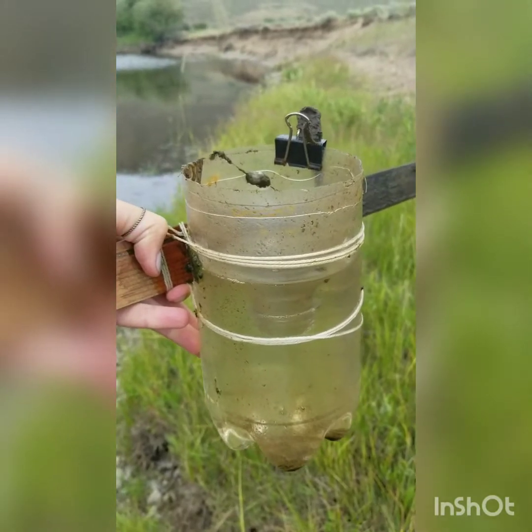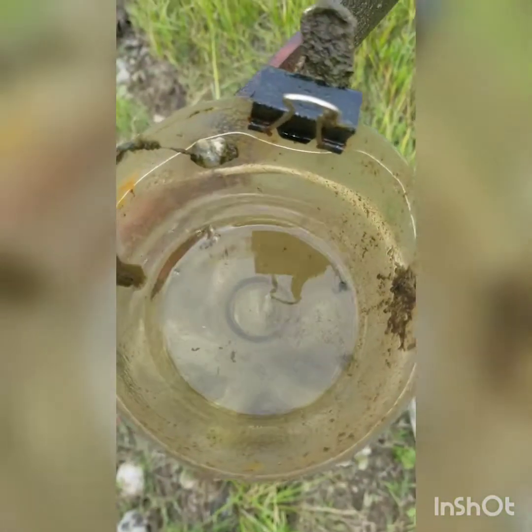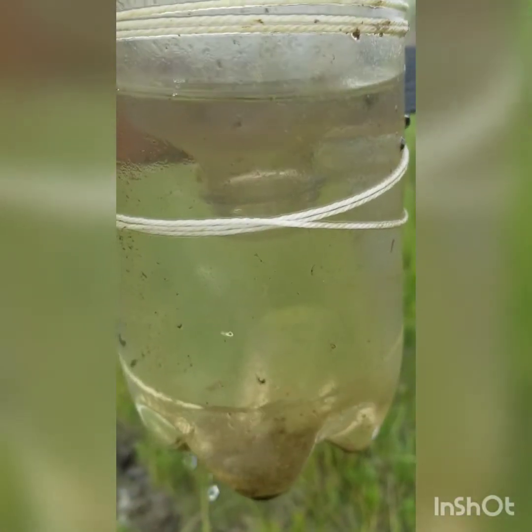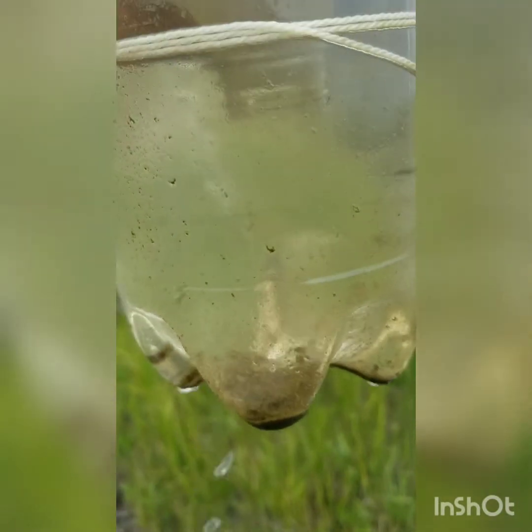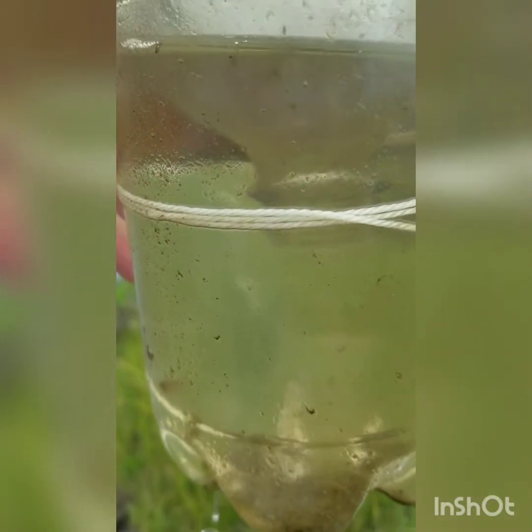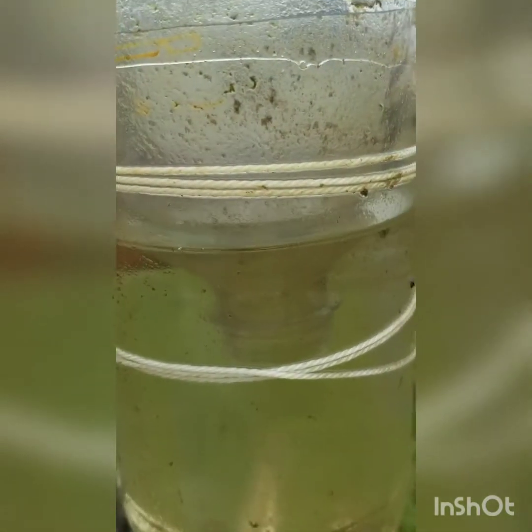The trap itself is not that high tech. It's just a 2-liter soda bottle with the top cut off and inverted in there to make a funnel. I'll show you some of what we've got once I put it into the vial, but you can kind of see stuff swimming around in there. These riparian plots tend not to have a ton of inverts in them. They do get the occasional fish, however. So we'll go ahead and pour this into the bucket.